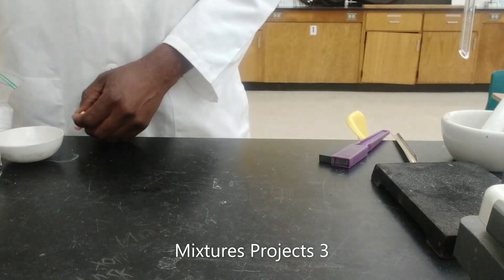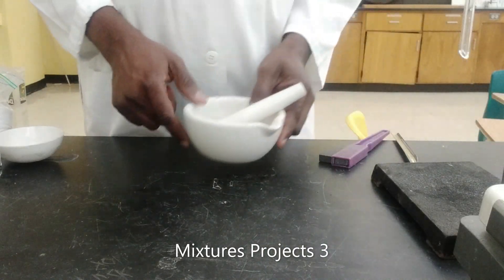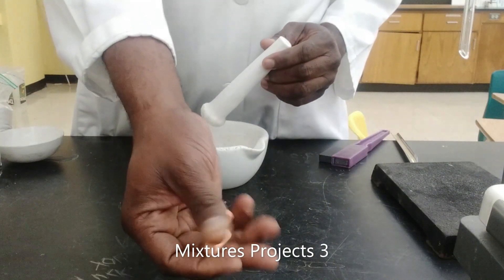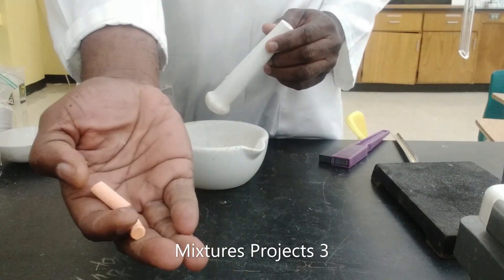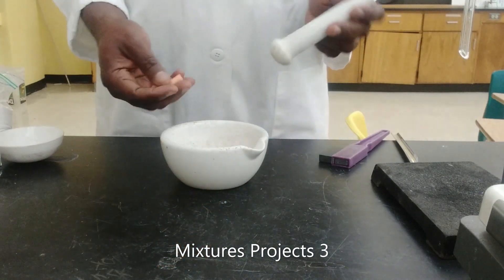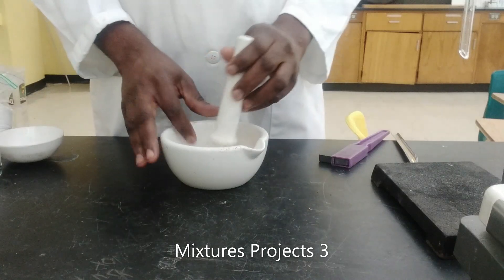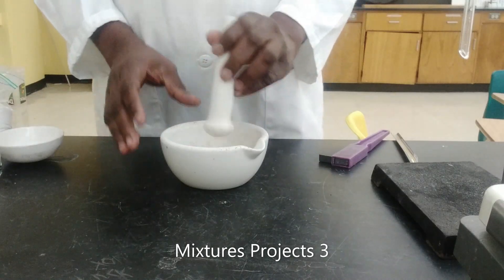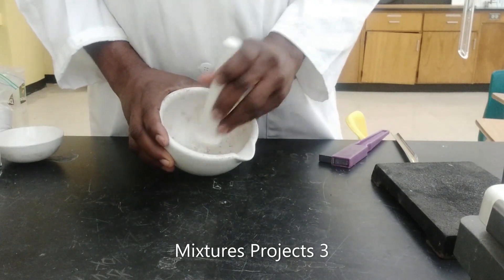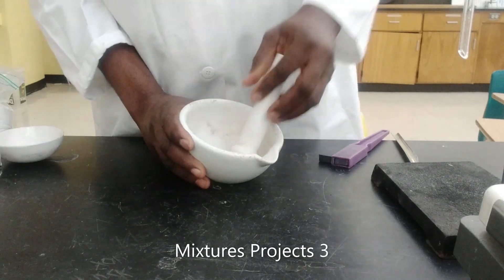I will be creating the mixture. First we are going to break up our chalk. I have some little pieces of chalk sticks here, and I am going to break it up into little bits in my mortar and pestle.